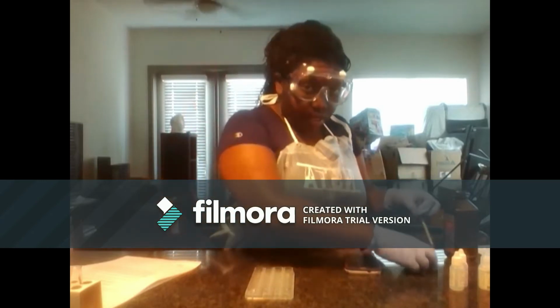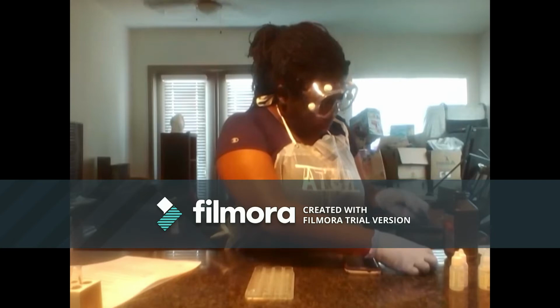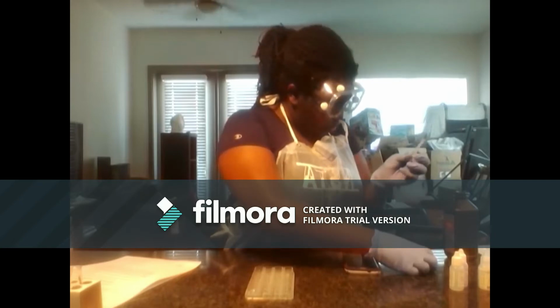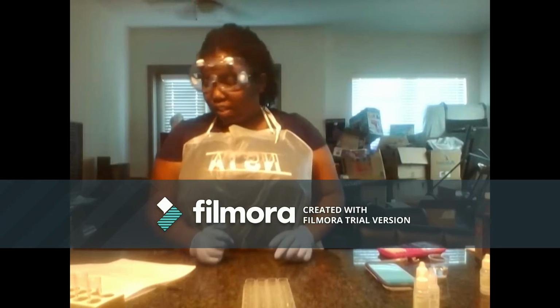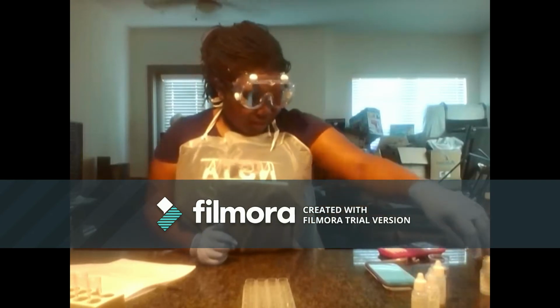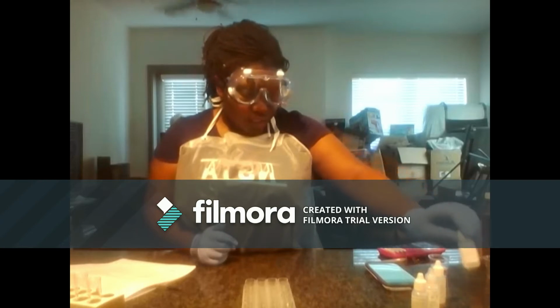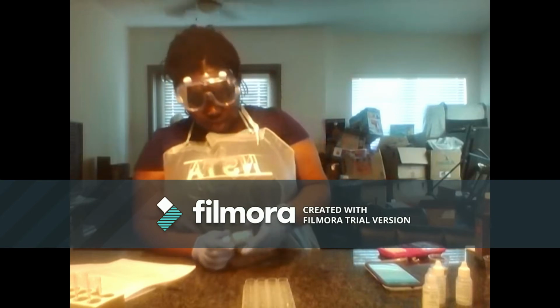And then I will add 0.4 mLs of hydrogen peroxide. Alright, so we'll start with activity 2. I found that 8 drops of sodium thiosulfate was sufficient to meet the time requirements, so that's the way I'll be using it in the rest of my experiments.